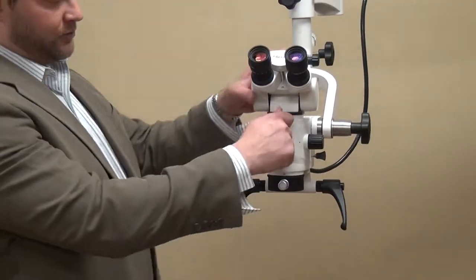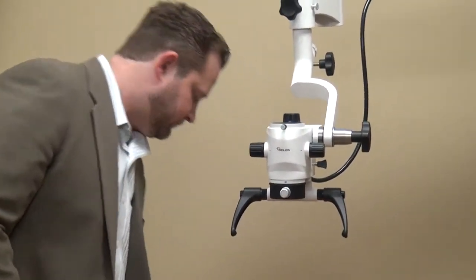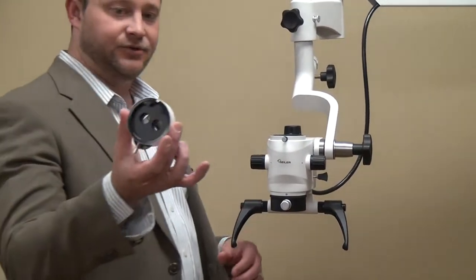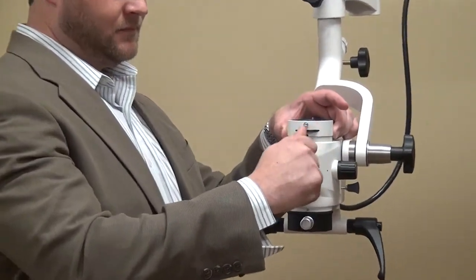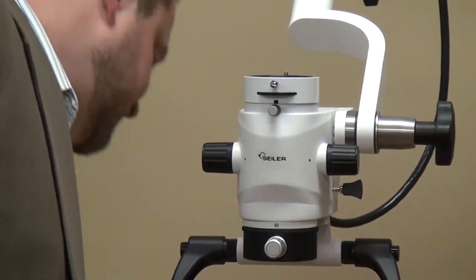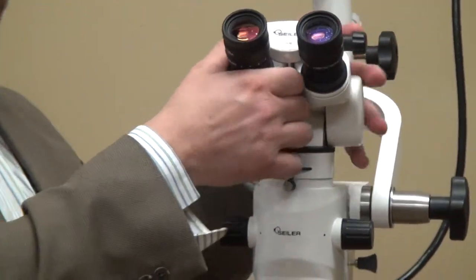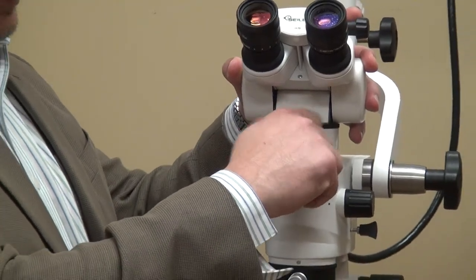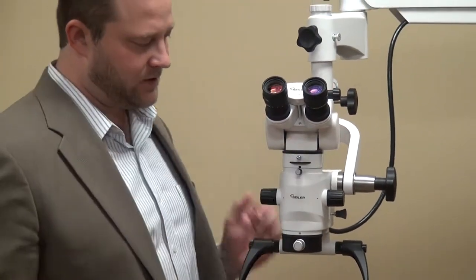So very simple to use. Remove the binocular head, place the dual iris diaphragm, lock it into place, put the 0 to 220 degree head on, lock it into place. Now you're done.